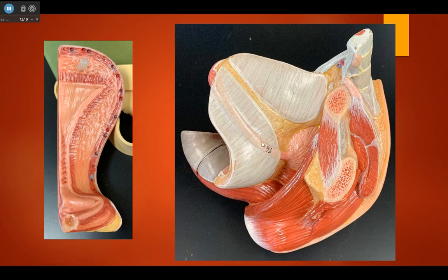Outside, again, the broad ligaments here. So we have the mesometrium and the mesosalpinx from the outside. And here's that mons pubis and the labia majora. Here we have a cross-section of the uterus. So we have the fundus of the uterus, the body of the uterus, the cervix of the uterus. Layers, we have the endometrium, we have the myometrium, and we have the perimetrium.